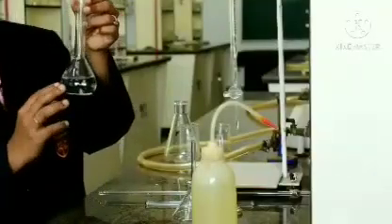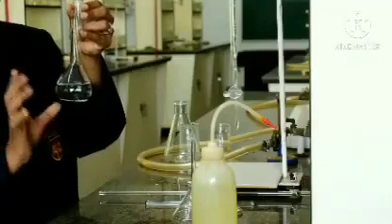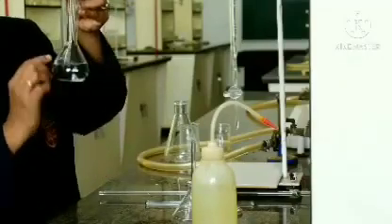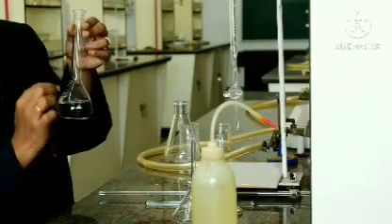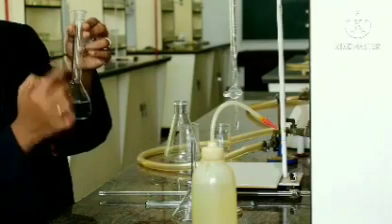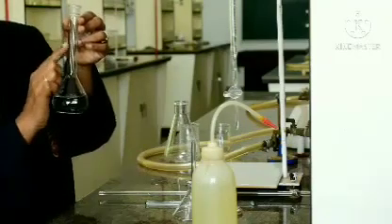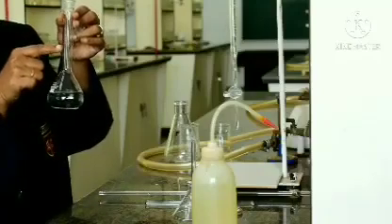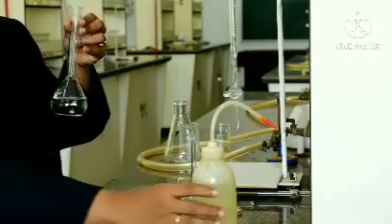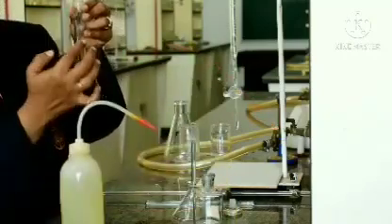So, now we have completely transferred the solution from the reagent bottle to the SMF. Now, as I said earlier, there is a small mark on the top. So, we have to fill it till here by adding water. See that the mark should not be exceeded. The level of the solution should not go above the mark. So, for this we use water. Let us add water to this to make it till the mark.